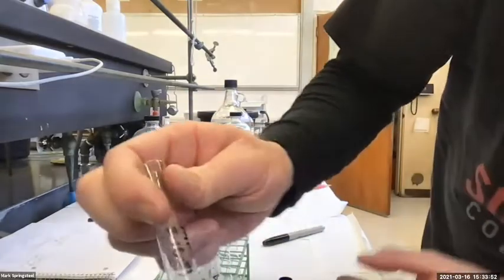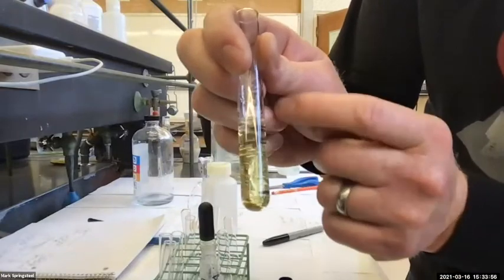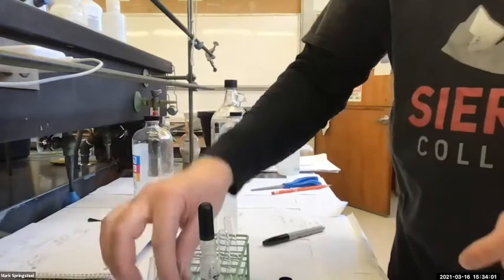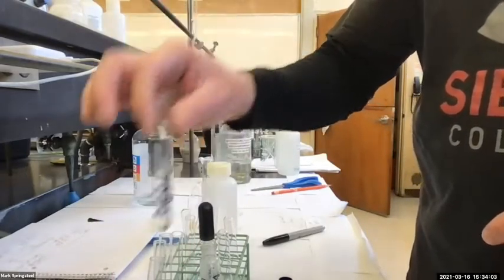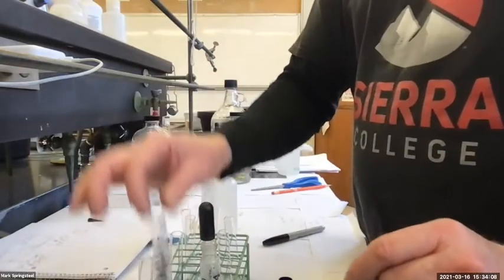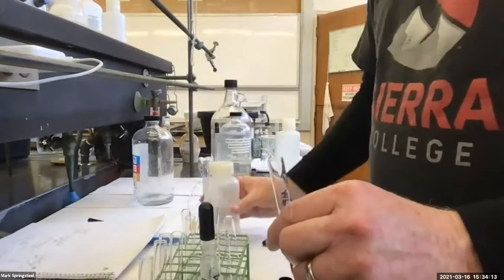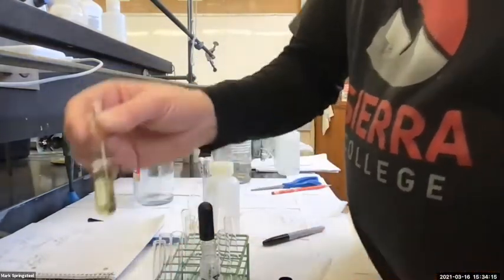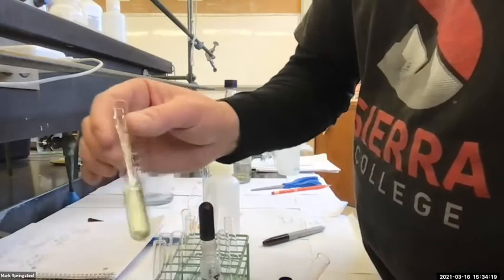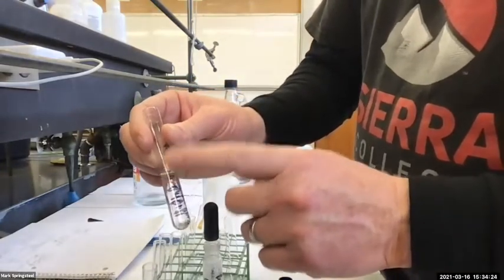Do you see how I've got a separate layer on top? Yeah. So this is definitely my organic. This is definitely my aqueous. What you should do whenever you do an extraction, and every time you separate an organic and an aqueous, you're usually pretty confident. Oh yeah, this is the aqueous. Just shoot a little water in the aqueous to make sure. And I normally wouldn't shoot it in the organic because I just want the organic to be organic. But I know I'm going to extract this with another 1 molar HCl, so it's okay.